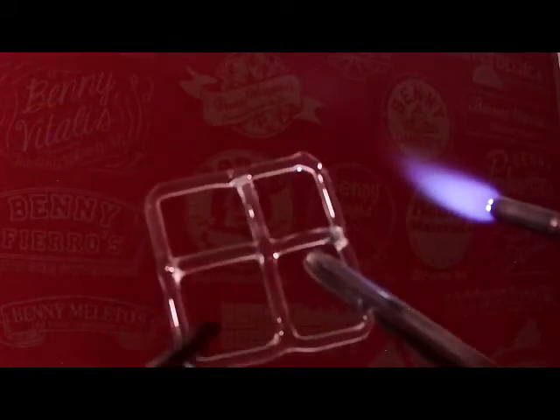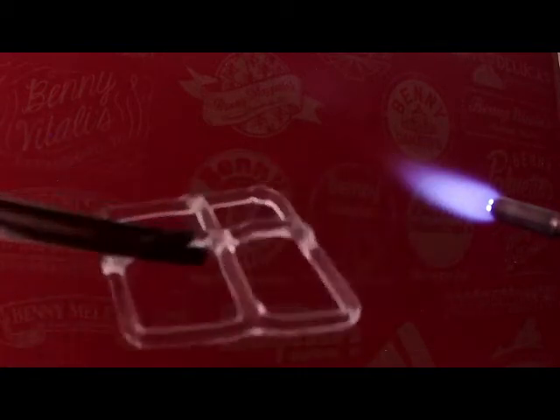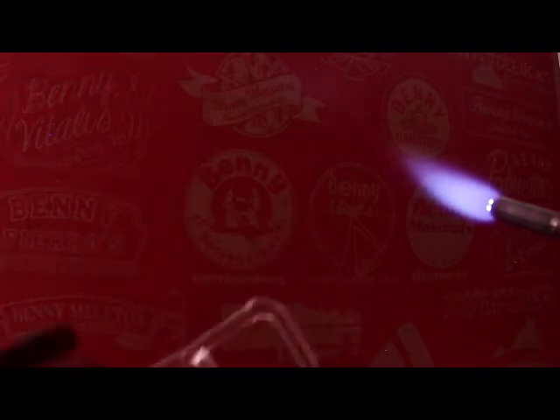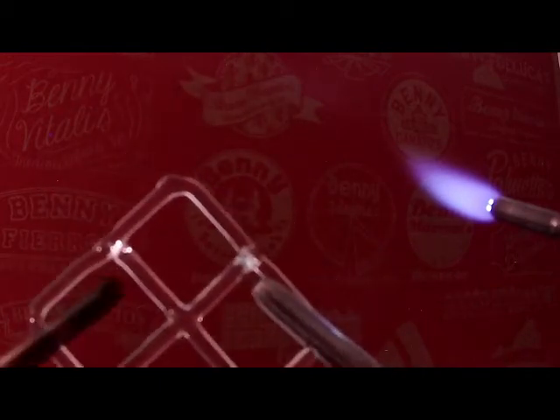And there we go. So now I've basically got this little square, a grid, and whatever you were trying to make, this is your starting point, right? I could take this and put legs on it, and now I've got a little sample holder or even potentially a little stand. If I make another one of these and connect them together, I could start to make essentially a cube or do all kinds of things like that.